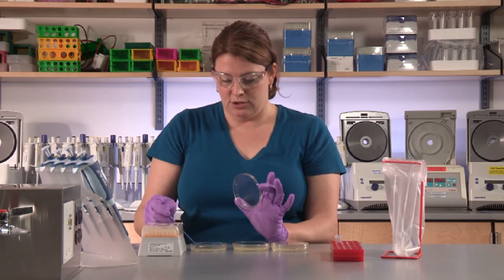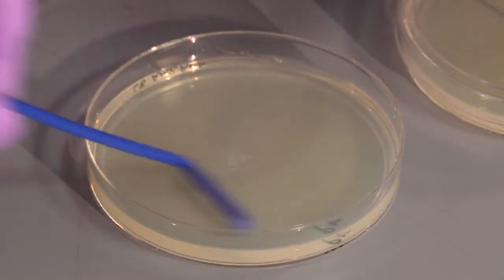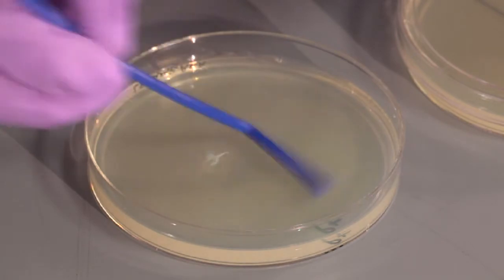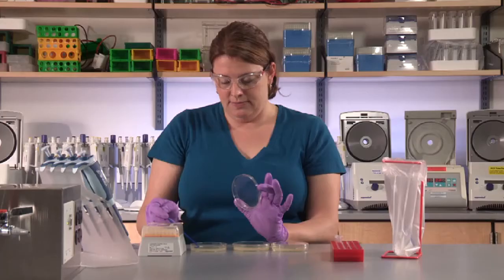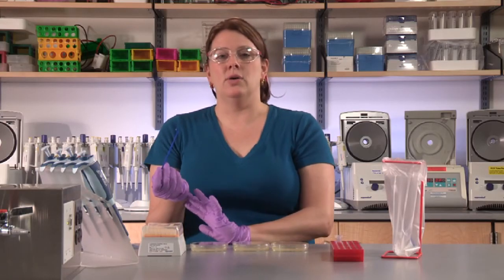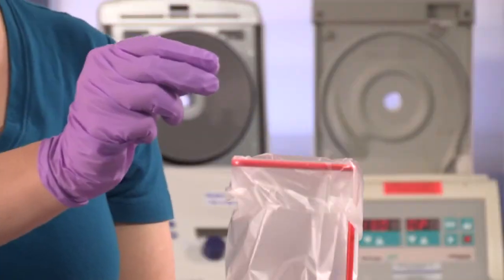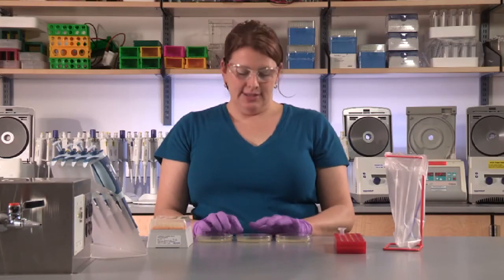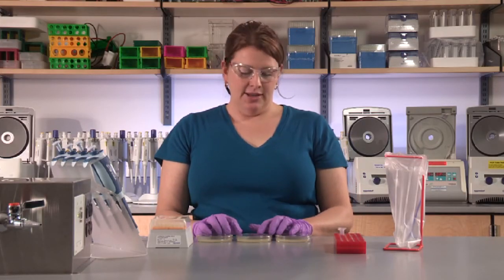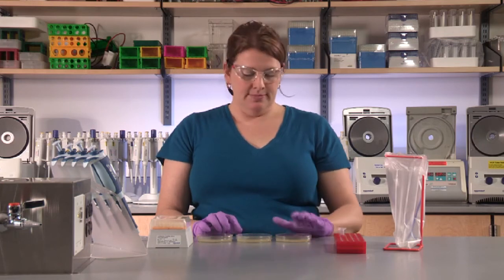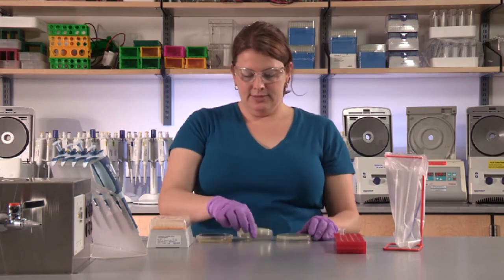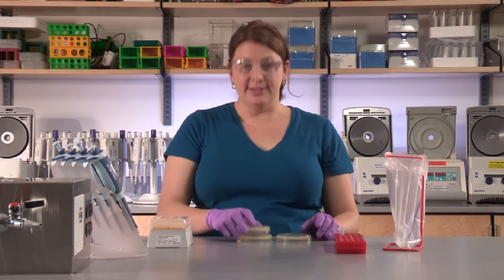This last plate, the entire surface is P+. You don't want all of the solution to go to the sides. You want it evenly dispensed. Put the lid back on quickly. Dispose of your spreader. Let the plates sit on your bench top for at least five minutes so that the liquid can be absorbed. Invert the plates and stack them.